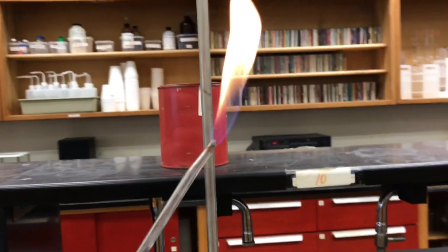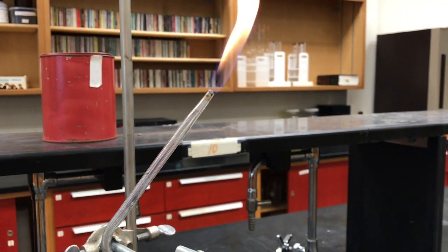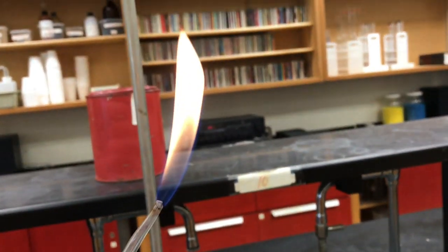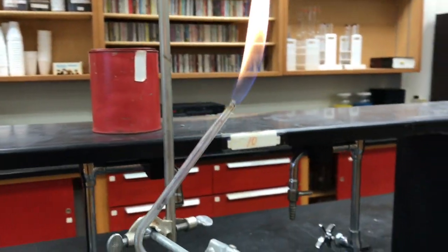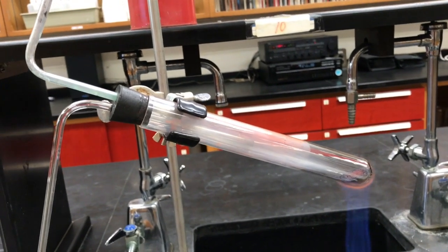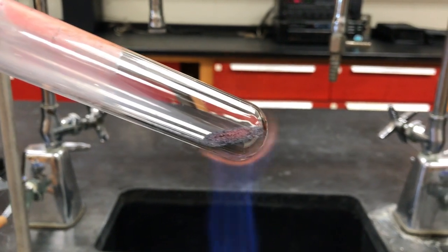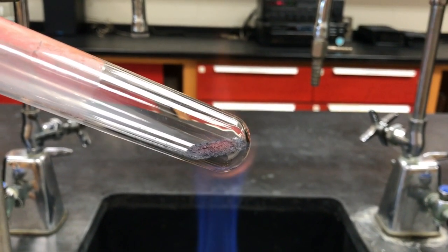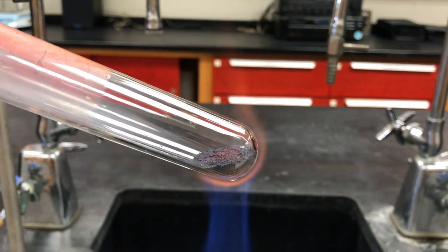And the reason why the top is burning is because the excess methane that's not reacting with the copper is being burned off. I went ahead and lit it with a match. So this is to make sure that the excess methane doesn't fill the room and potentially build up. You can actually see that the red copper is turning to blue, or sorry, black. And this reaction is going to take a while, so we're going to come back and visit it later.